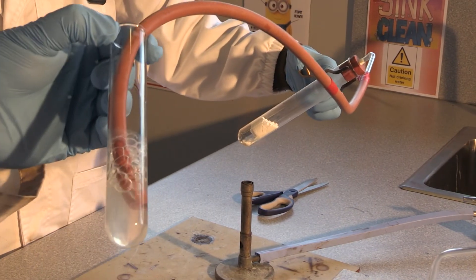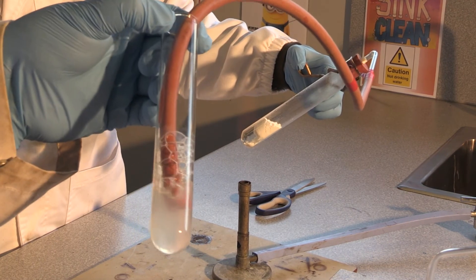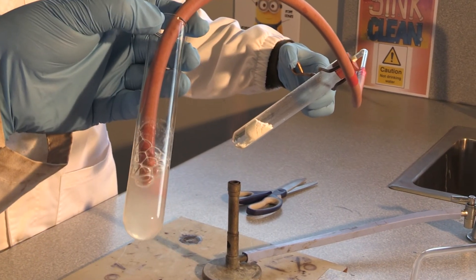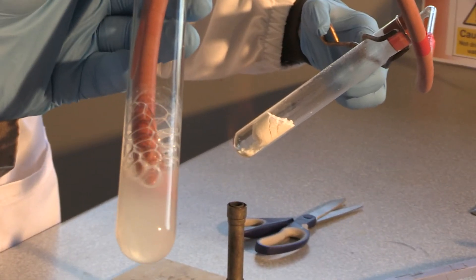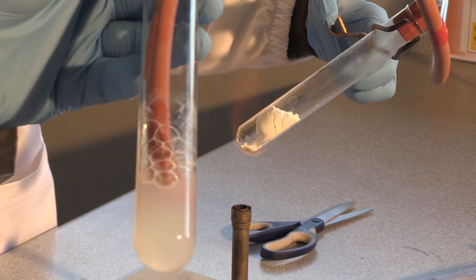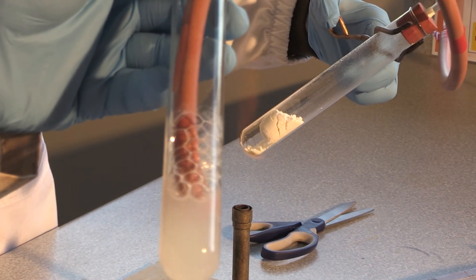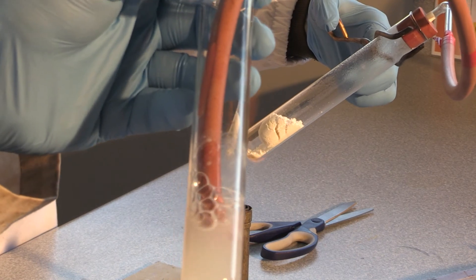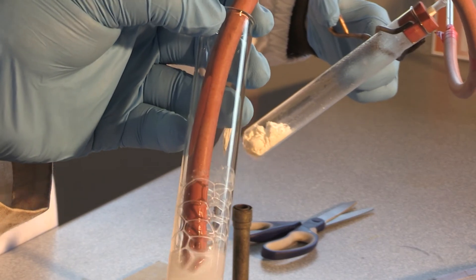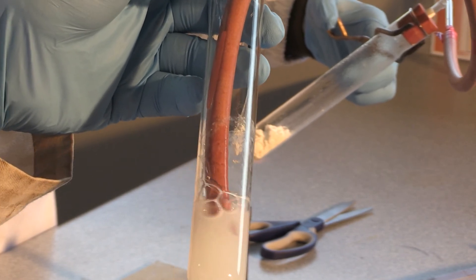As we go a bit further you can see that the water is now turning cloudy. I'll try and get a close up of that. Alright, and that is number one done — that's what we're looking for, that's our evidence. Our limewater has turned cloudy. I'll hint at what the gas is in the assessment. Our product is decomposing, and we might do another one focused solely on getting a close up of the product because it does have a physical change that we see.